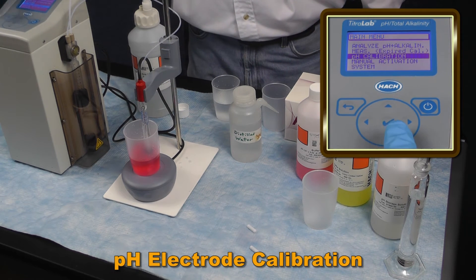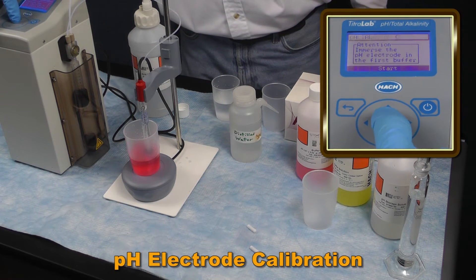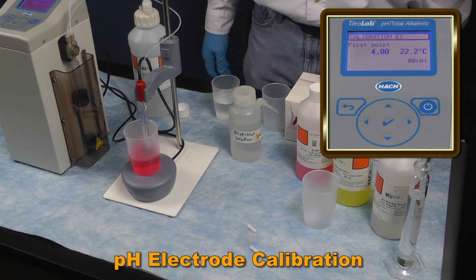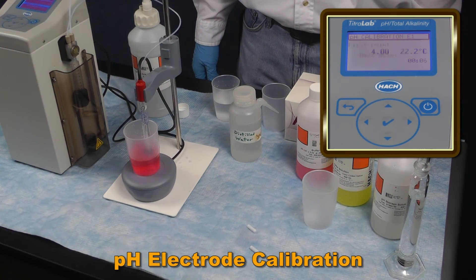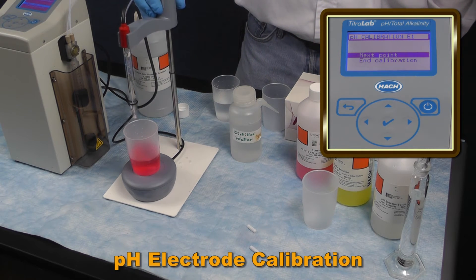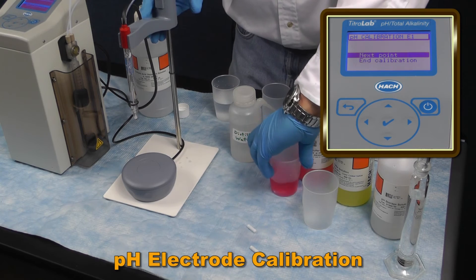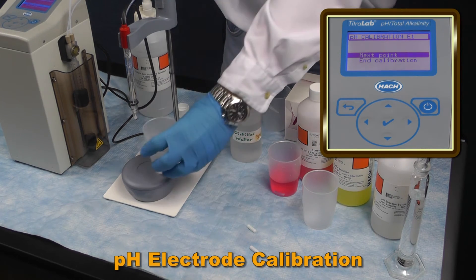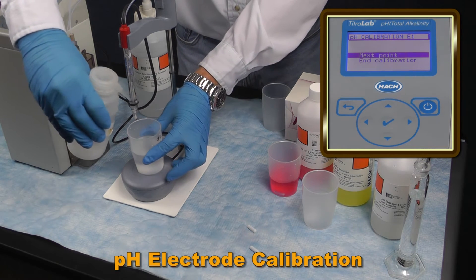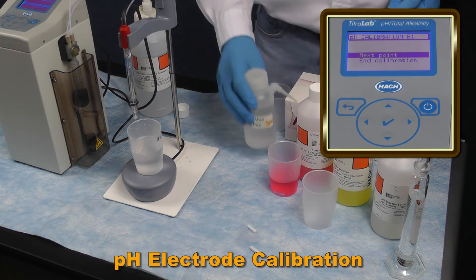On the screen, select pH Calibration and continue to measure the pH buffer. After the reading is stabilized, raise the probe out of the sample cell and place your waste beaker under the probe. Rinse the probe with DI water once again and blot dry with a chem wipe or AccuWipe.